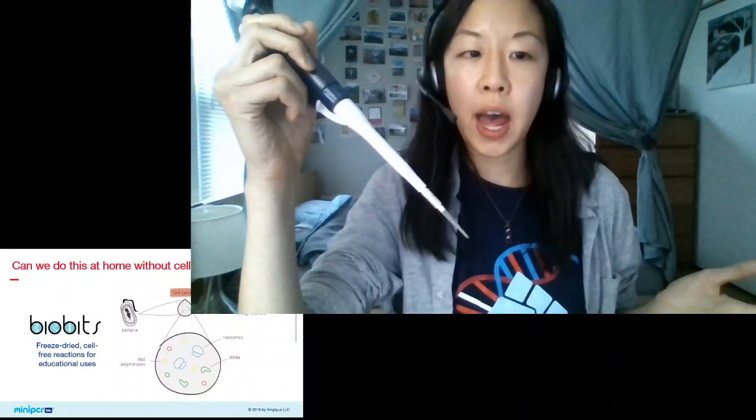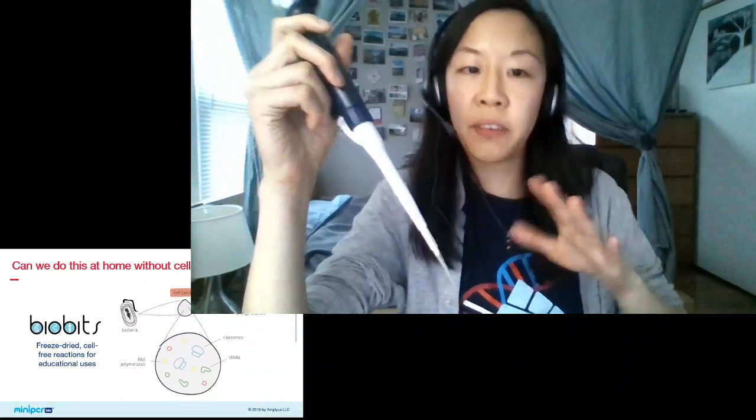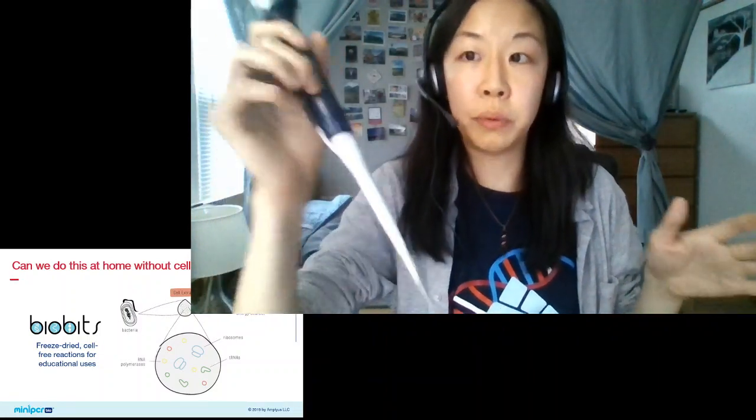Quick disclaimer, everything I am using today is perfectly safe to use without gloves or goggles, which is why I'm not wearing them right now. However, just make sure you follow your local guidelines if you do this lab in your classroom or at home.